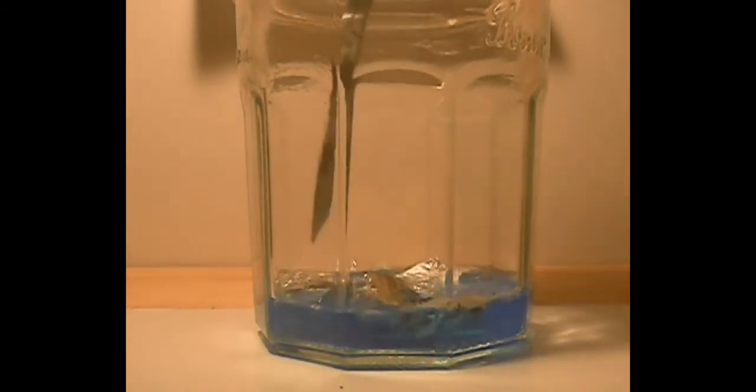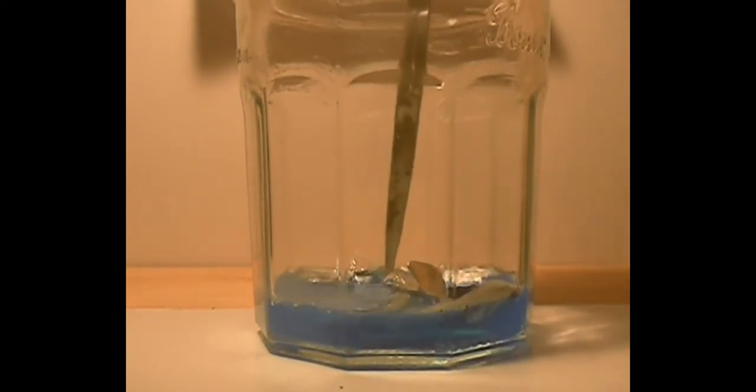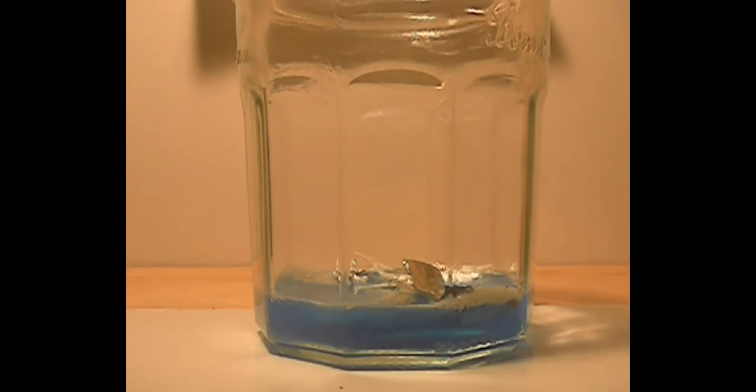Push it down a bit. Yeah, so I'm probably going to let this sit here for a little while, maybe keep adding aluminum till there's no sodium hydroxide left, and then we'll come and dry it off.